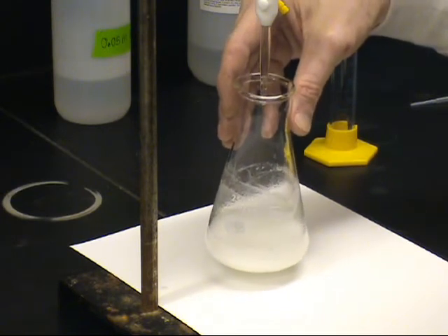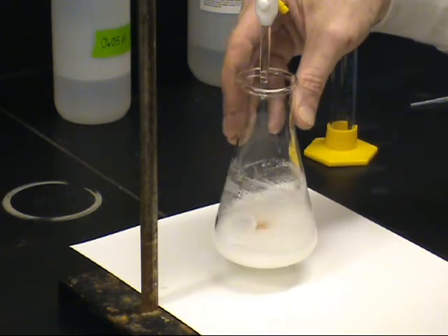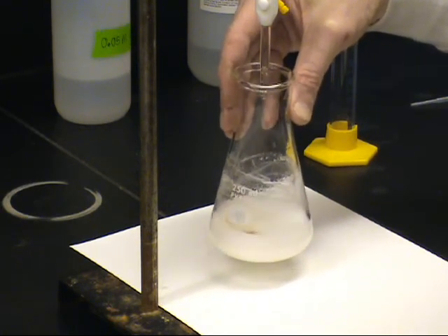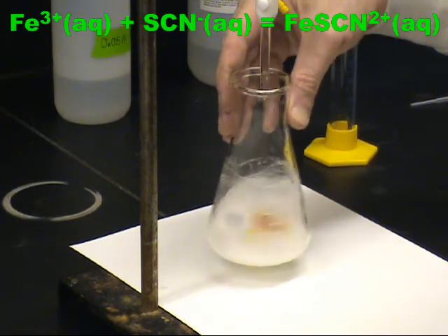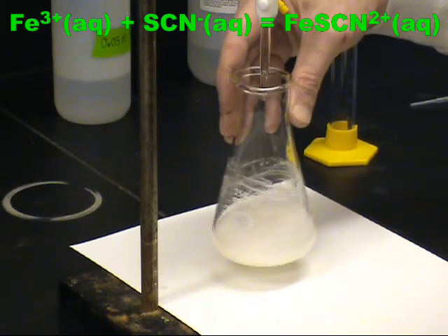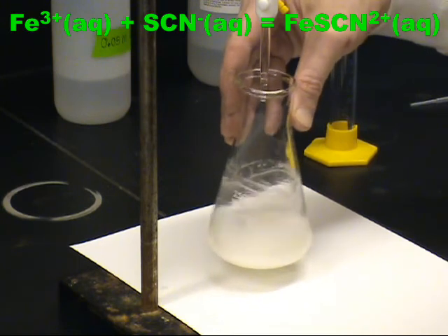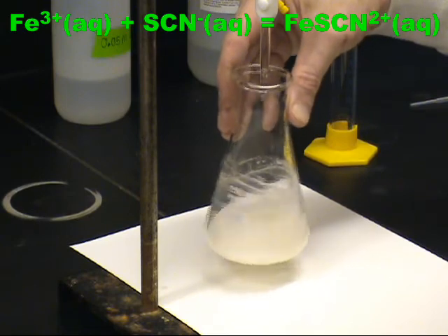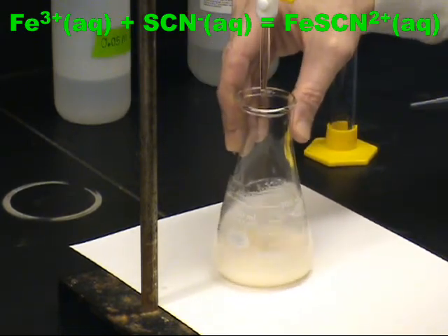Once there is no longer any silver to precipitate out, the thiocyanate begins to combine with the iron 3 to form the iron thiocyanate complex ion. Ordinarily, this appears blood red in color. Here, greatly diluted down and mixed with the silver thiocyanate precipitate, it appears closer to pale orange in color. Stop the titration with the first color that persists throughout the entire solution.